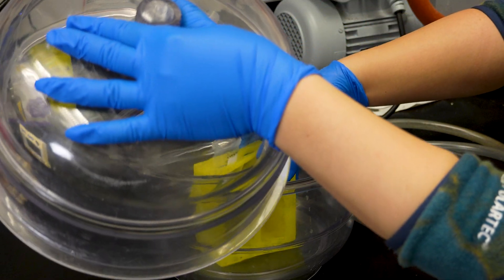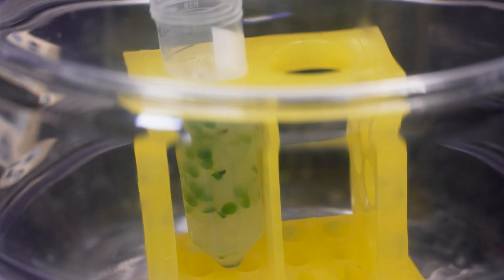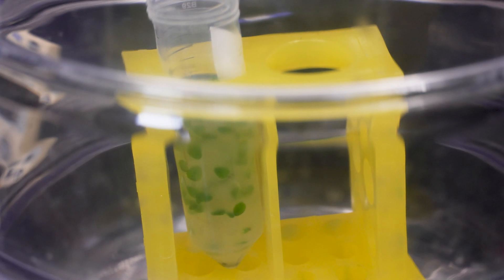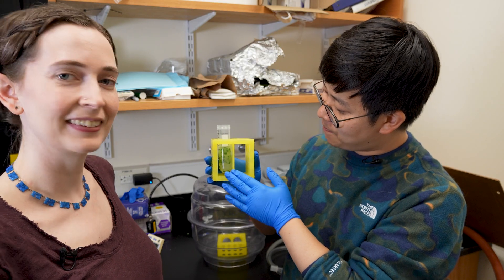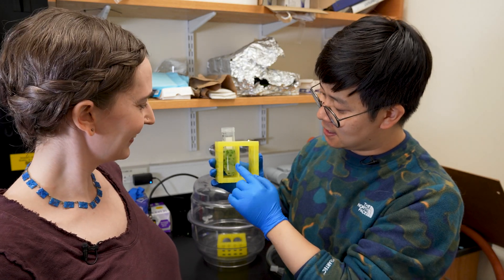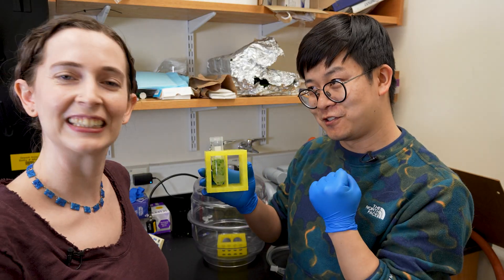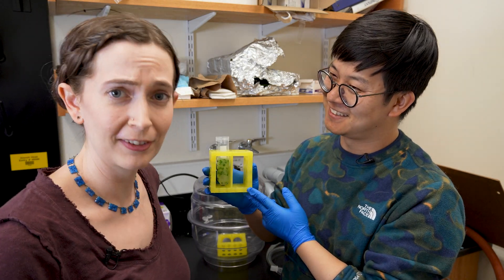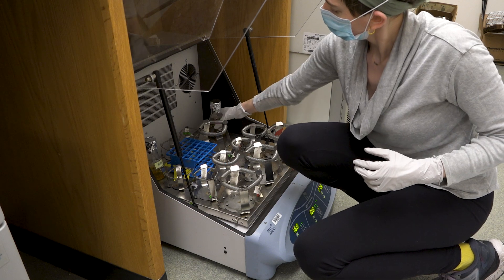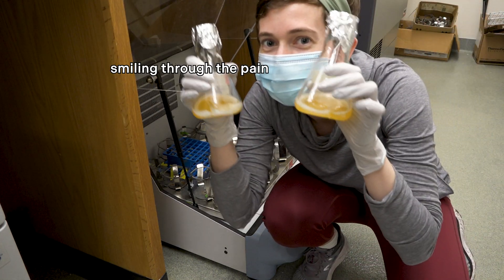Now I'm going to turn on the vacuum infiltrator. You're going to see magic. Oh my god. Now a lot of bacteria have been put inside the plant tissue, and you can tell because the leaf color is now much darker green — and now we are halfway through. This is so much easier than VIGS. That's right. VIGS was the very limited gene transformation tool we had before this and it was the bane of my existence in grad school.